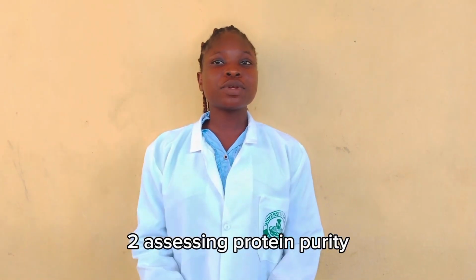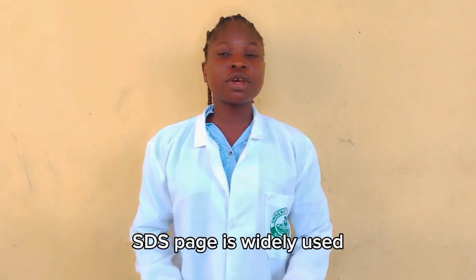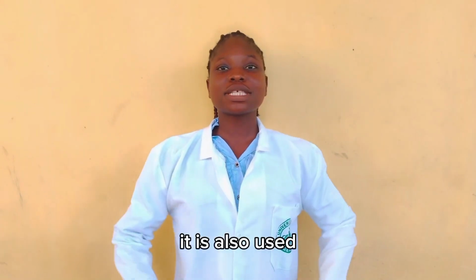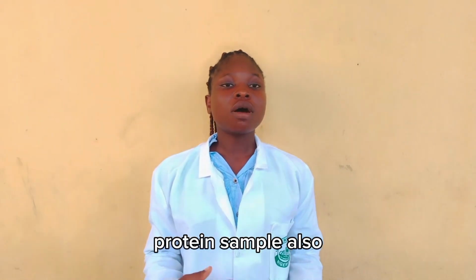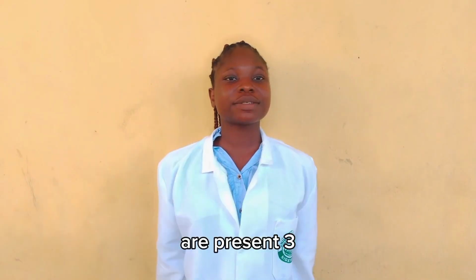2. Assessing protein purity. SDS-PAGE is widely used during the protein purification process. It is used as a single band to indicate a highly pure protein sample, and as multiple bands to show that contaminants or other proteins are present.